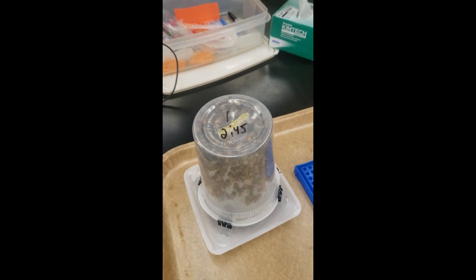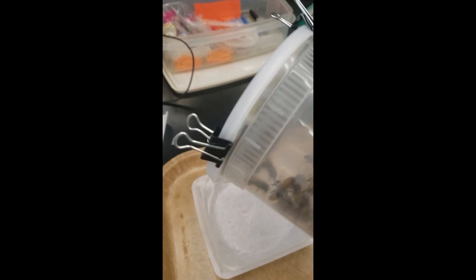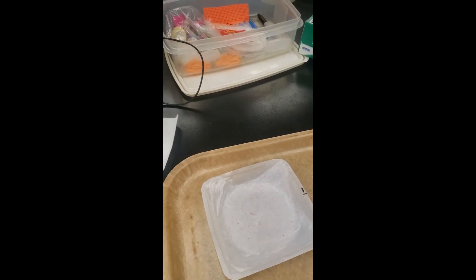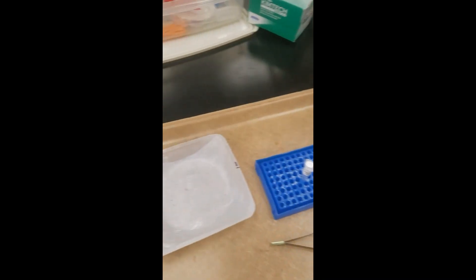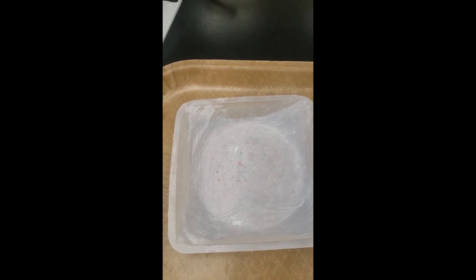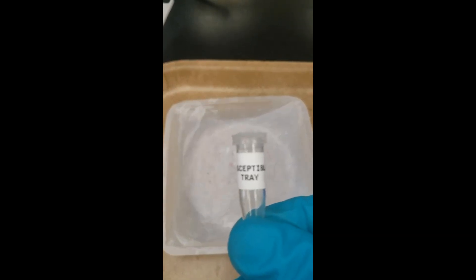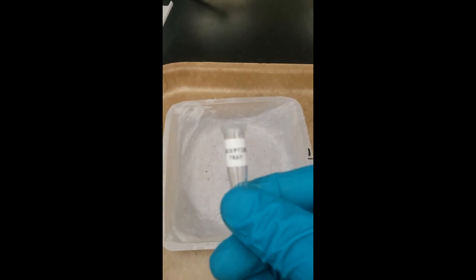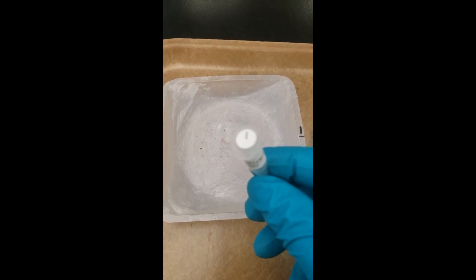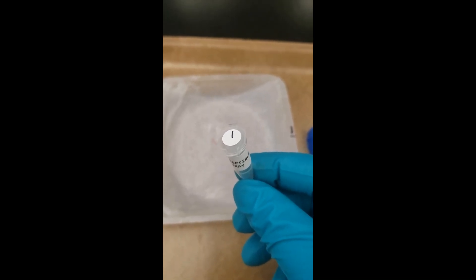It's been three hours and now we're going to finish the test. To finish the test, take the cup and hold it upside down so no more Varroa will drop out of it — the screen will be facing up. Inspect the tray for Varroa. We're going to pretend these little red dots here are Varroa — you can see a number of them. We then need to collect the Varroa on the tray into this tube labeled 'susceptible tray' with a white lid on top. This is what we use to collect the susceptible Varroa from the tray.